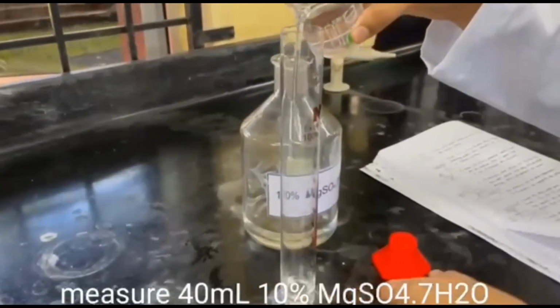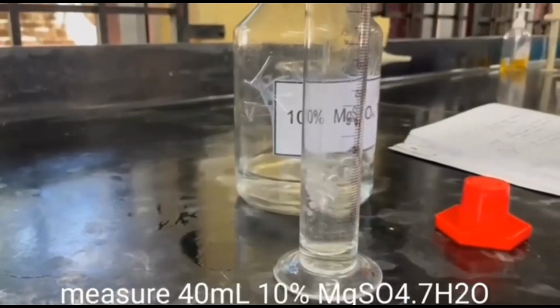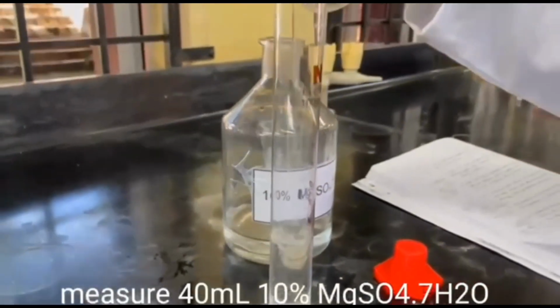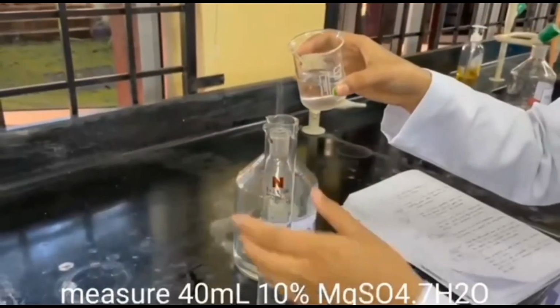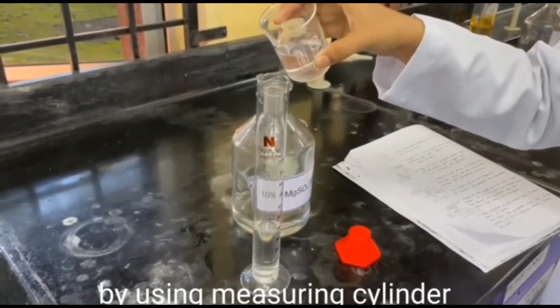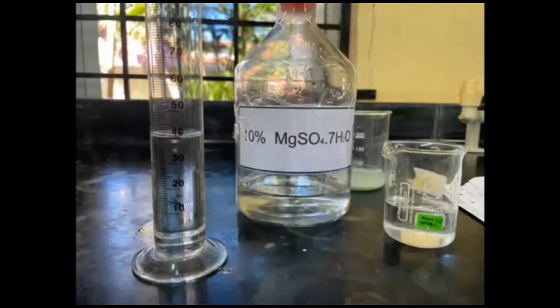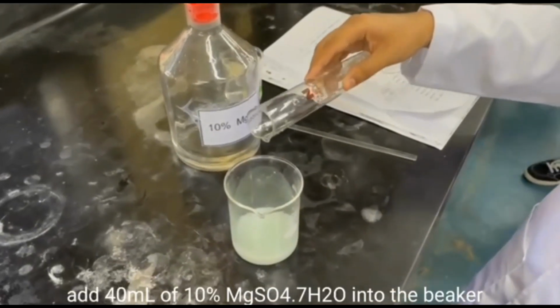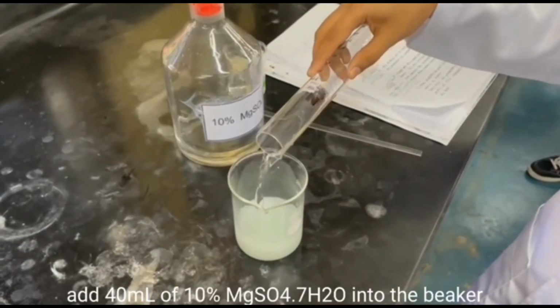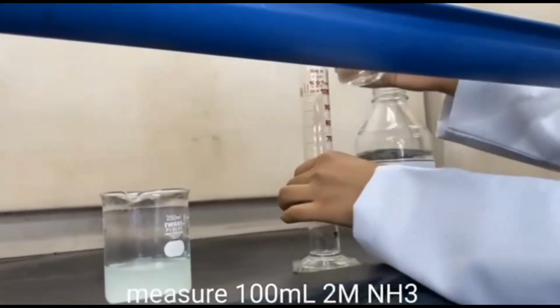Measure 40 ml of 10% magnesium sulfate heptahydrate, which is done by using a measuring cylinder. Add 40 ml of 10% magnesium sulfate heptahydrate into the beaker.